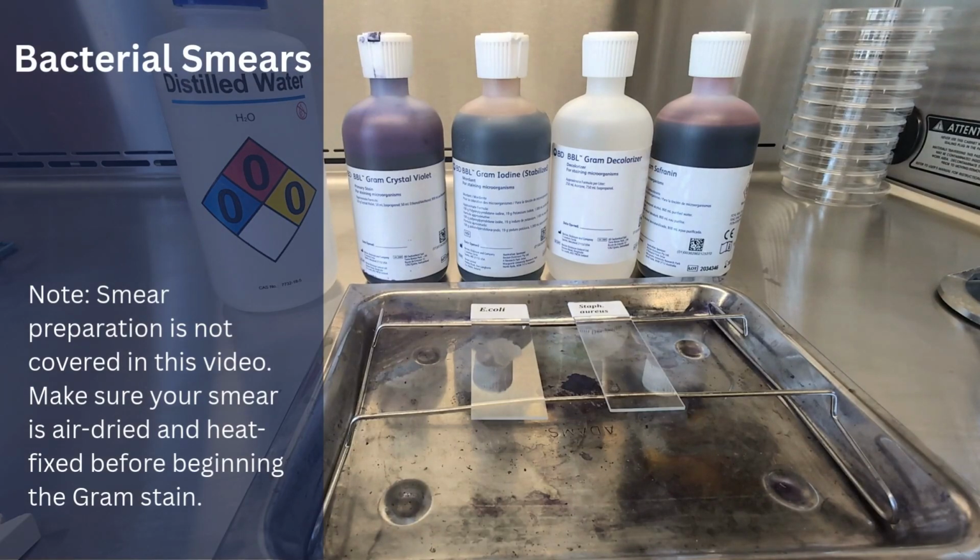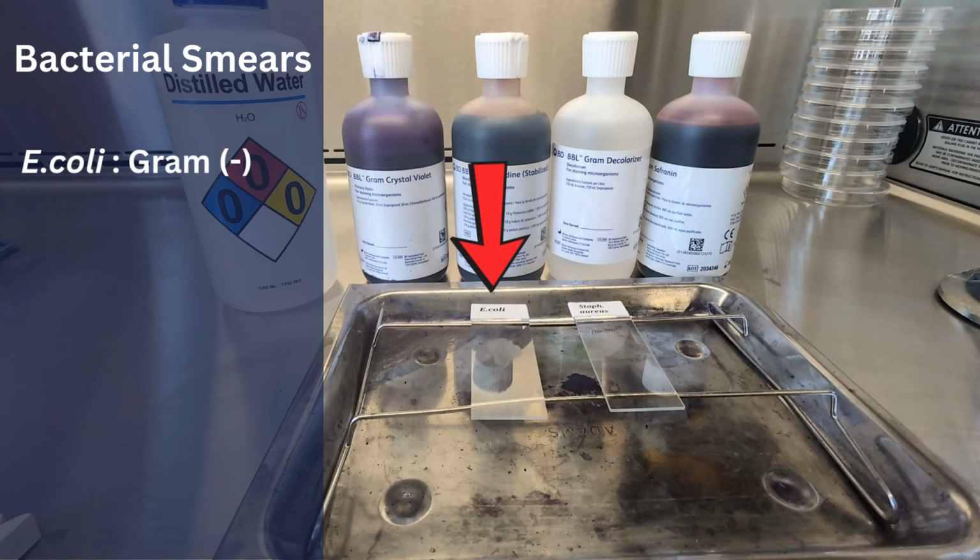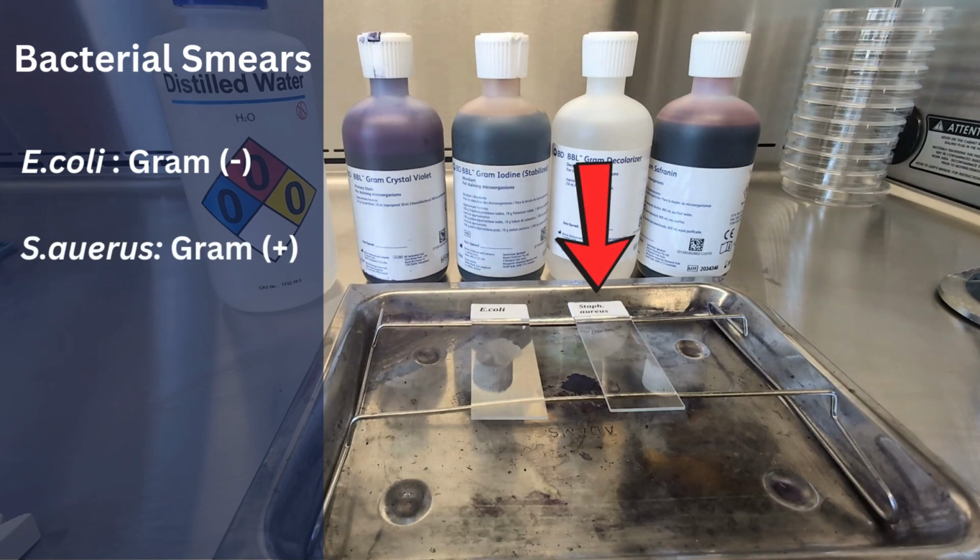Before you begin the gram staining process, remember that you'll need to have a prepared bacterial smear on your slide. In this video, we'll focus on the gram stain itself. For this demonstration, I have two bacterial smears prepared: E. coli, which is a gram-negative bacteria, as well as Staph aureus, a gram-positive bacteria.